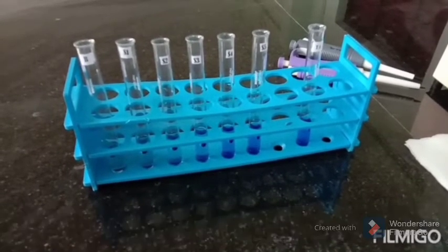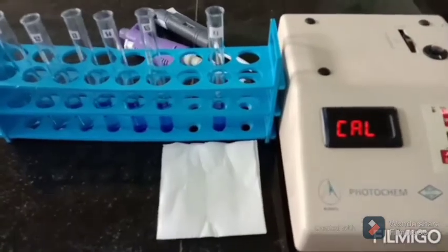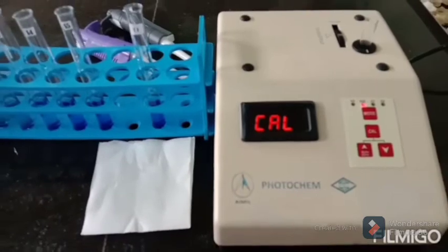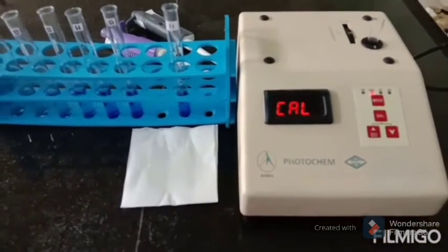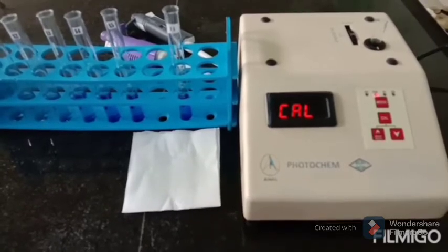And now you can see a typical brand colorimeter switched on to warm up for about 5 minutes before calibrating. This is colorimeter. Keep in mind that never pronounce the instrument name as calorimeter. It's a different instrument used to measure specific heat in physics.